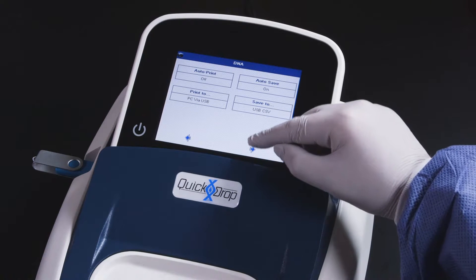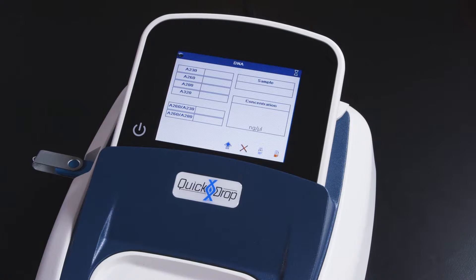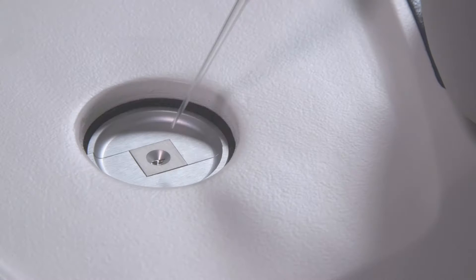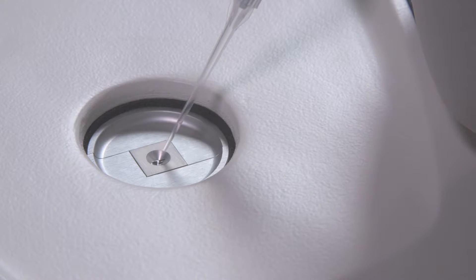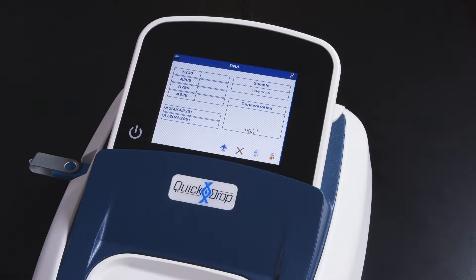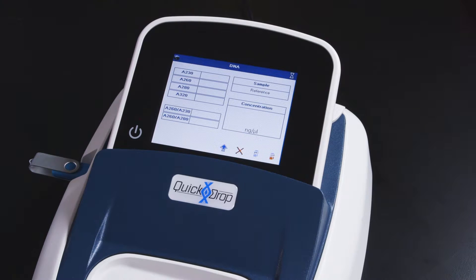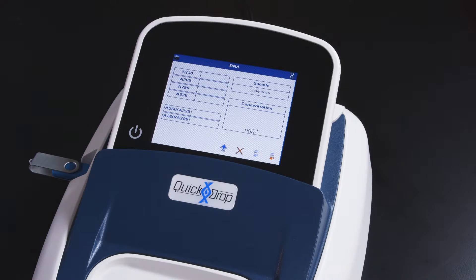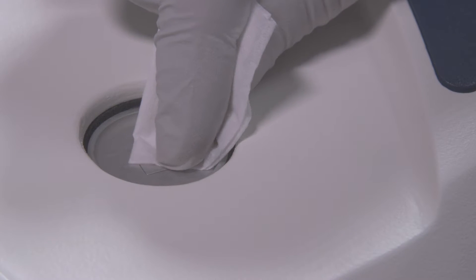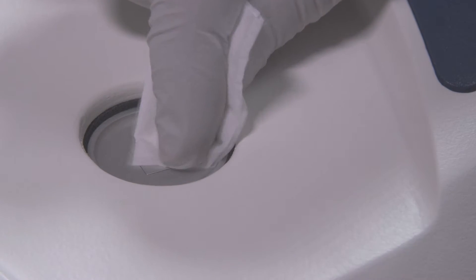Now we're ready to read a blank sample. You may pipette between 0.5 and 2 microliters into the microvolume sample port. After loading the blank, touch the clear cuvette icon to set your background reading. Now that the blank read is complete, take a folded lint-free wipe and wipe the sample port.